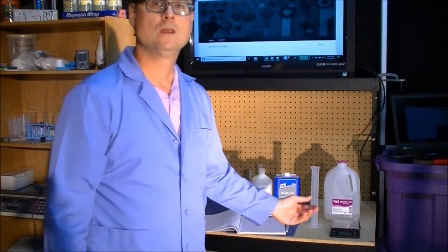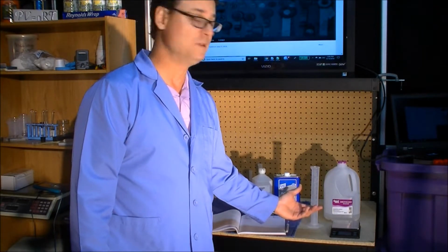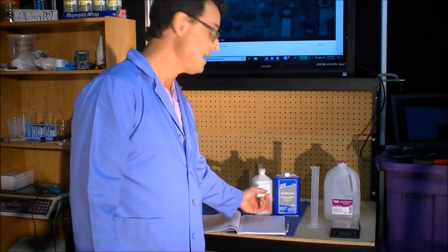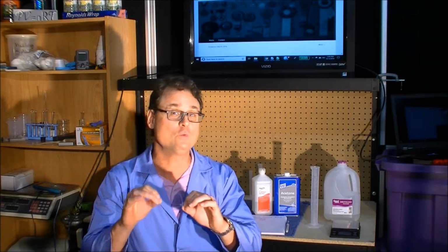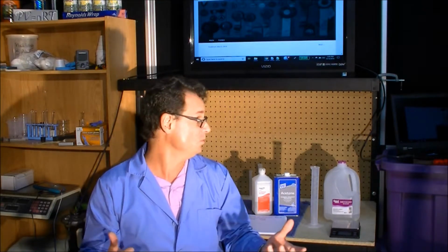Alright, we've chosen to do our experiment in three relatively common liquids: distilled water, acetone, and isopropyl alcohol. But there's no overwhelmingly strong reason for these three choices. The hypothesis is quite general. We don't want to test it in only one substance because it may be true in that one substance and not true in any others.